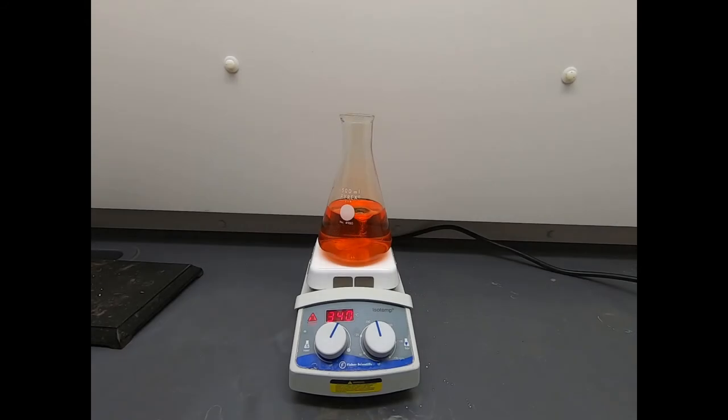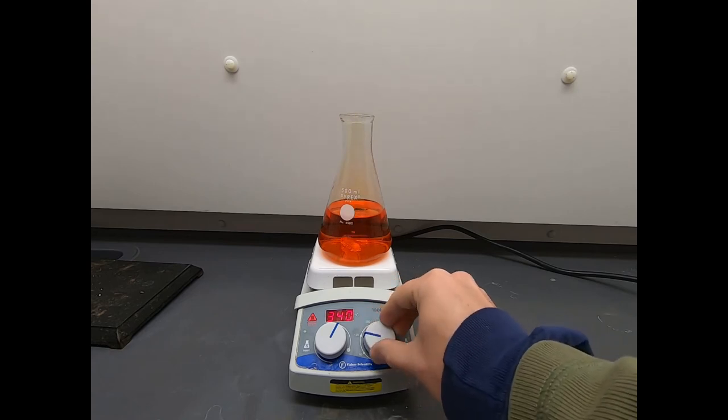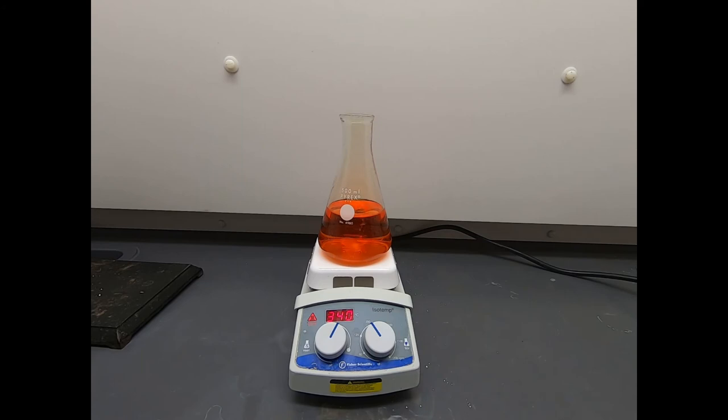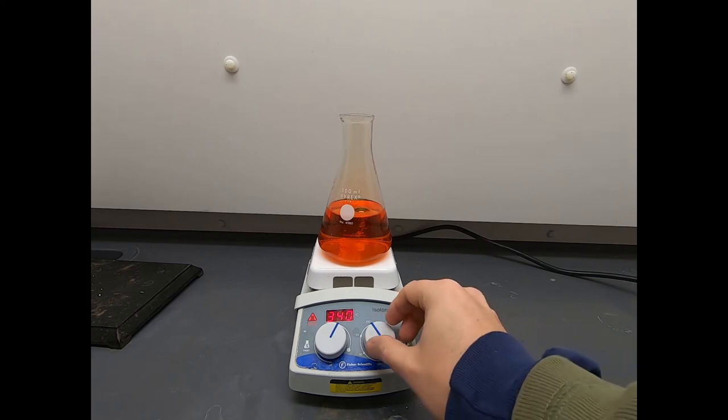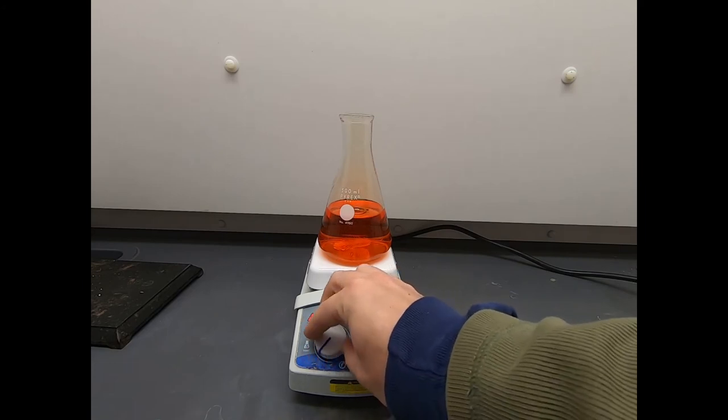Alas, we have everything dissolved, and in fact, it's starting to boil just a little bit. So we've pretty much achieved peak temperature. Not surprising, everything's in solution. So now what's next? Well we dissolved everything in a roughly minimal amount of solvent. Now we need to let this cool down, and as we let it cool down, the solubility of N-bromosuccinimide in water will decrease. And as it decreases, it should precipitate out, and so we'll hit saturation of our N-bromosuccinimide. Hopefully we never hit saturation in these other impurities, so they will stay in solution.